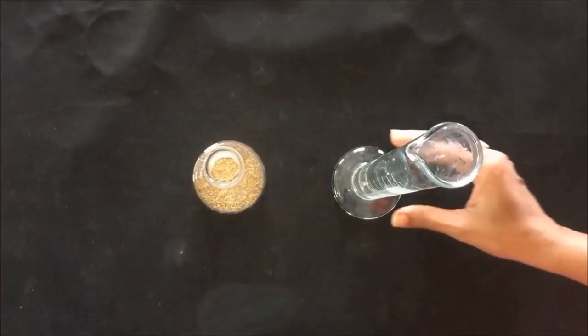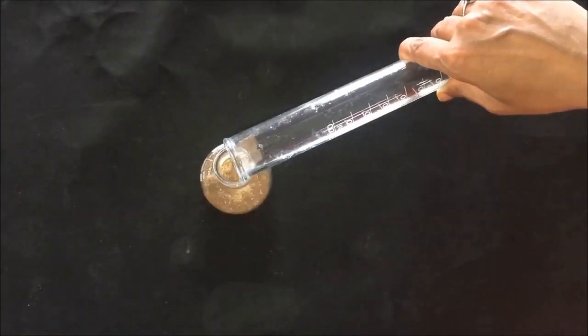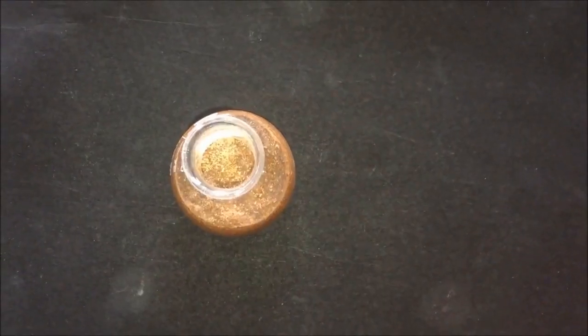In the phytochemical screening series, today we are going to perform the alkaloid test. Here we have taken about 5 grams of the sample powder for the alkaloid test and then transferred a sufficient quantity of ethanol. You can also use methanol in place of ethanol for the preparation of the alcoholic extract.